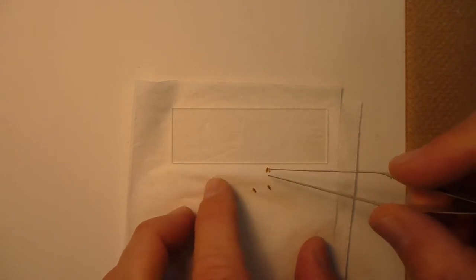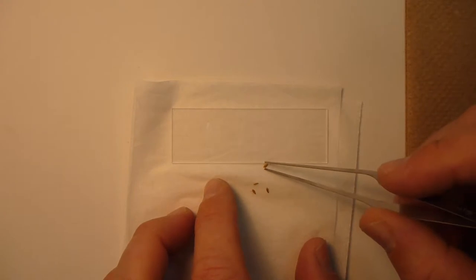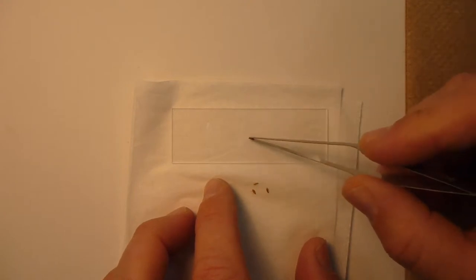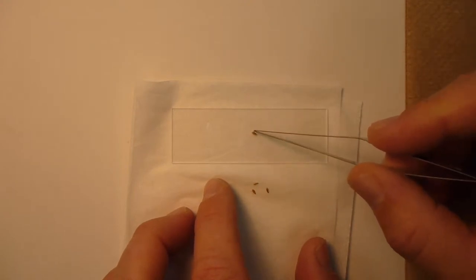When taking a specimen, a microscopic specimen such as a flea, or a thrips, or a louse, basically set it in the middle of the slide.